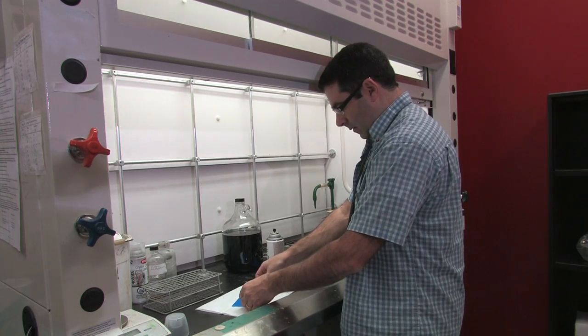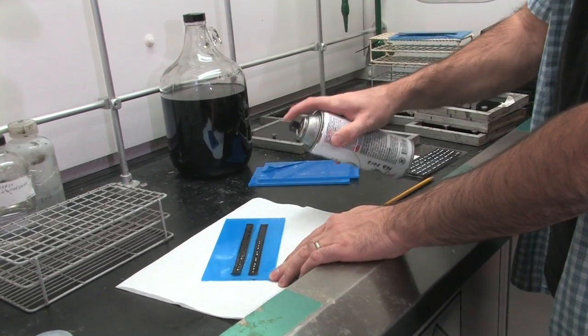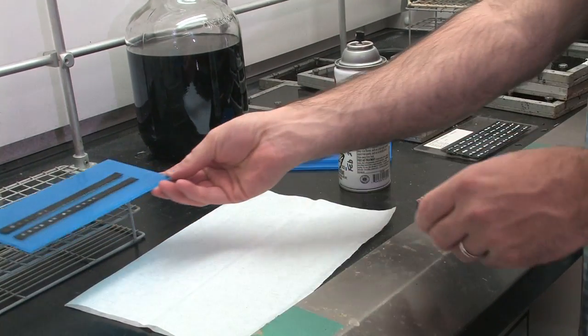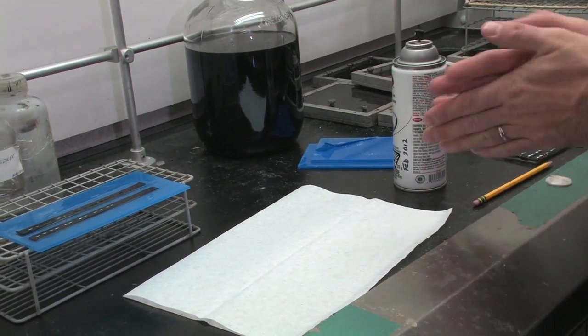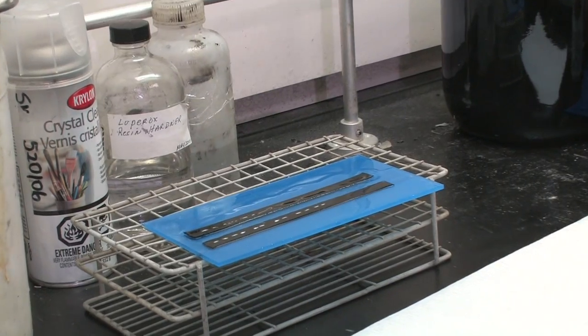Some tips when doing this procedure. If you number your otoliths on the strip, you will want to use pencil or a diamond pen. Otherwise, the Krylon will cause the pen or marker to smudge. You can put your label on before or after spraying. And again, this should be pre-printed or done in pencil so that it will avoid smudging.